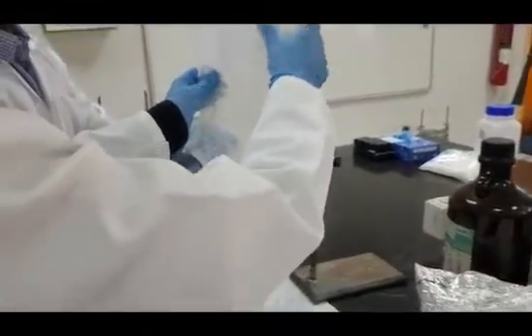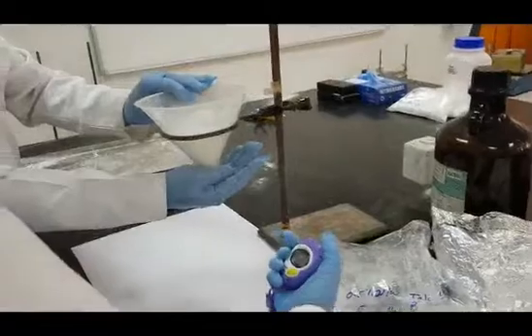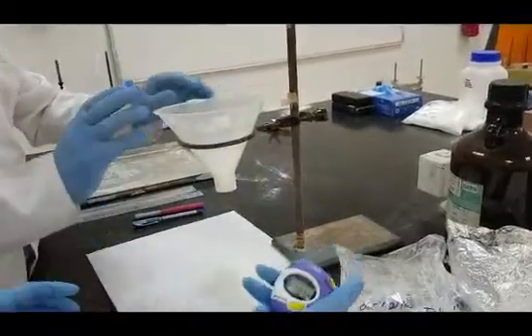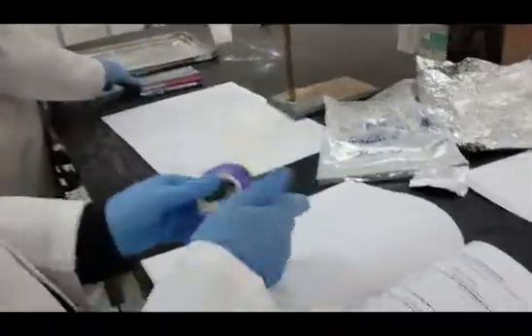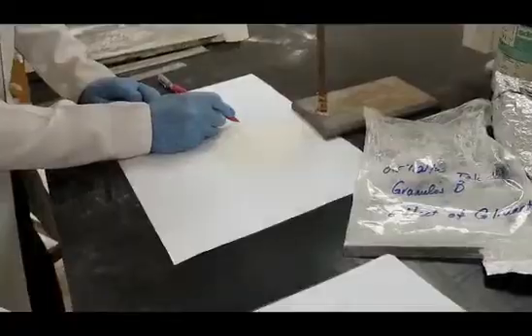Use the same procedure you used in the previous experiment to measure flow rate and angle of repose. Again, these procedures were measured for 100 grams of particles and in 3 trials.